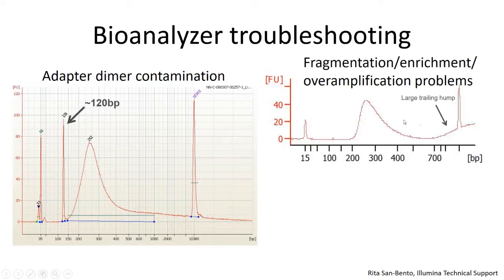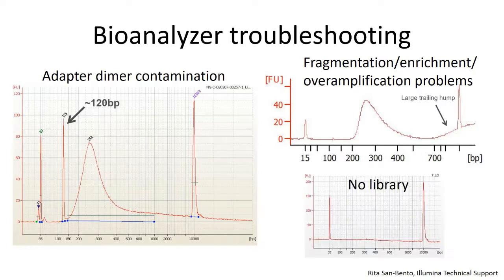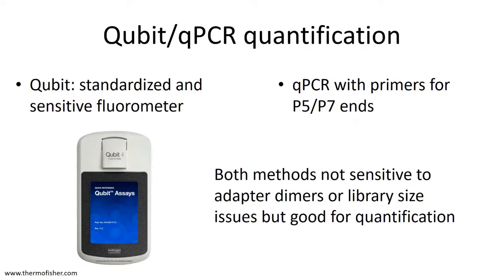Here's a library that shows problems with overamplification or potentially fragmentation or enrichment, in which you have a nice general distribution, but you have a really large trailing hump here that shows that there's a lot of long sequences in your library that really shouldn't be there. And this could be due to overamplification or problems with fragmentation. The bioanalyzer can also easily tell you if you have no library at all, in which case you should not sequence.